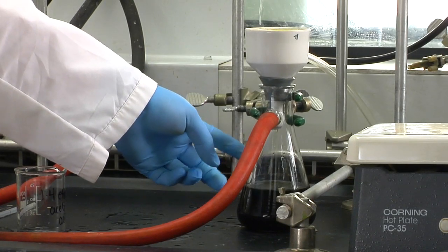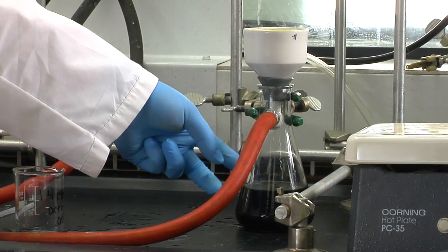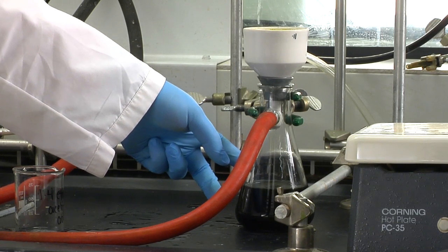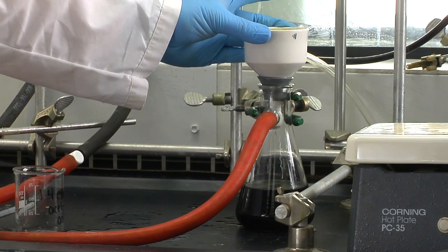Once the last few drops of your filtrate are clear, we can then move on to our third reaction. You want to do this quickly and you want to keep this moist the whole time.